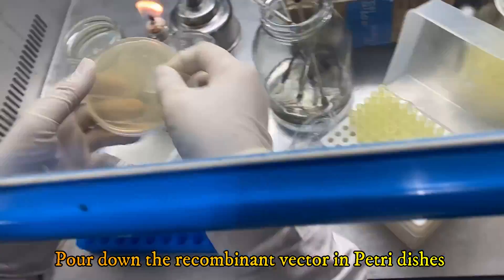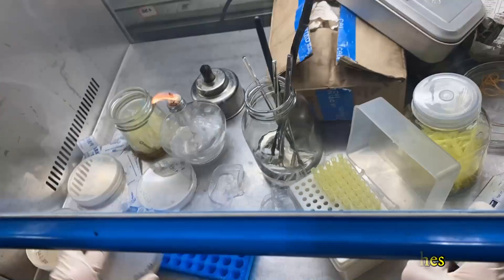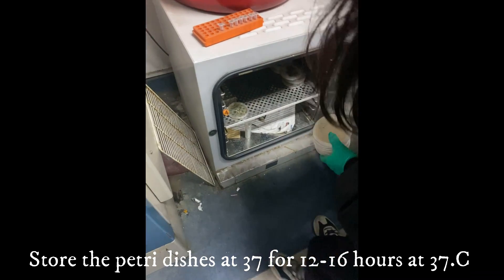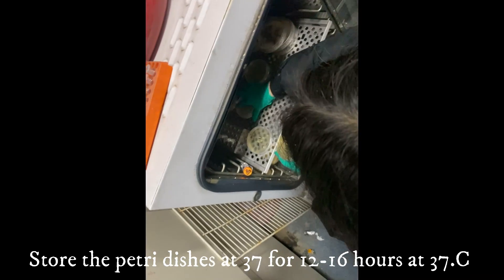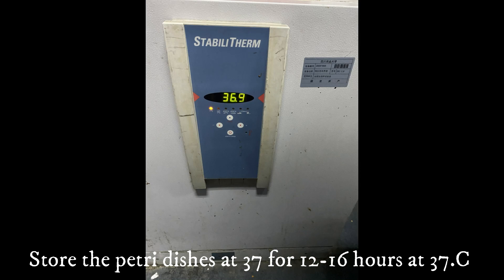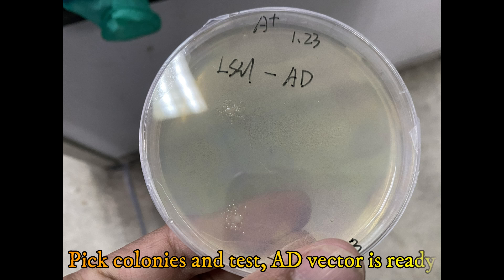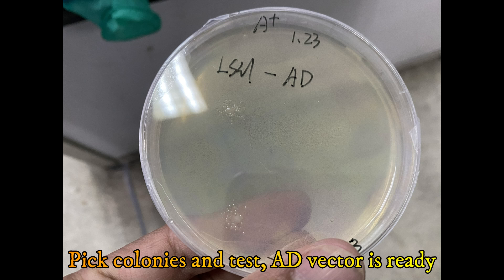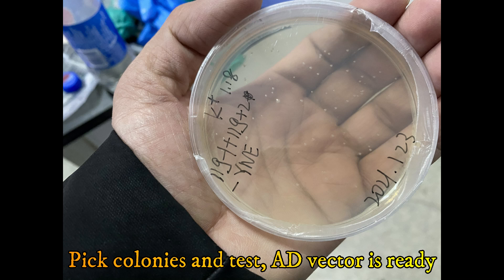Here I am fast-forwarding the video to avoid wasting time. We can put all the petri dishes at 37 degrees Celsius overnight. In the morning we can identify positive colonies by PCR test, and all the positive colonies are the AD vector.